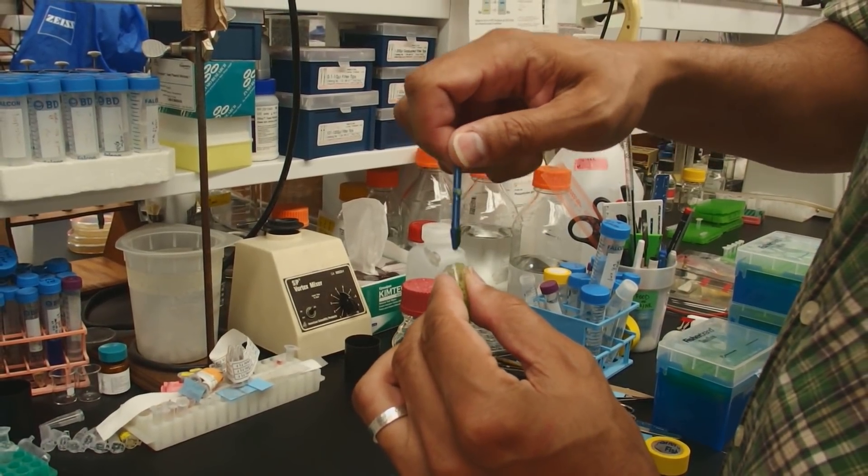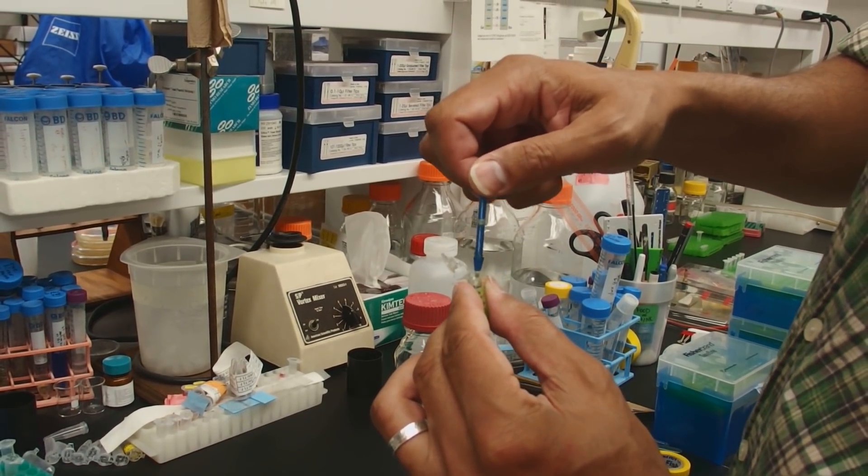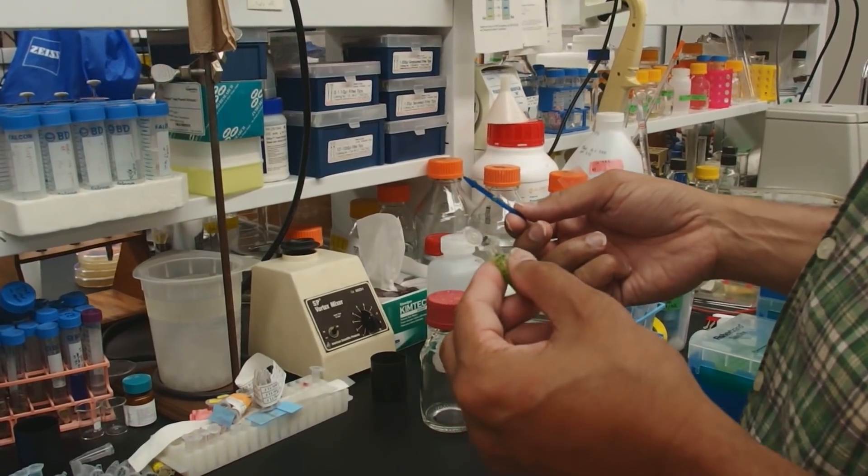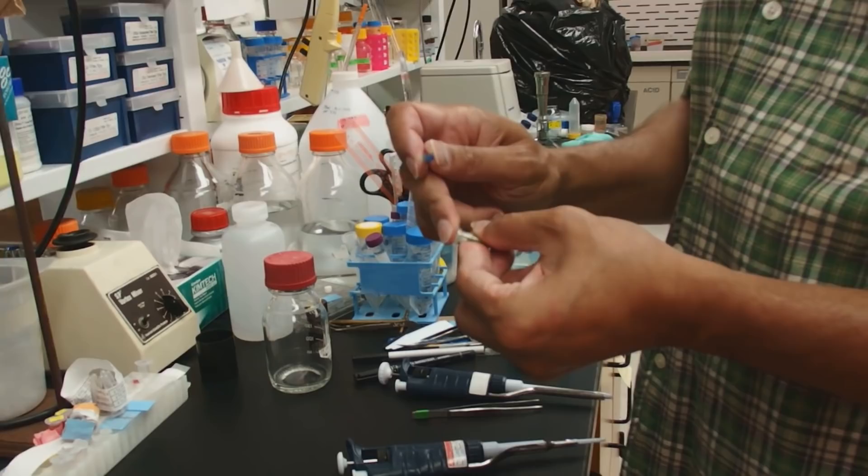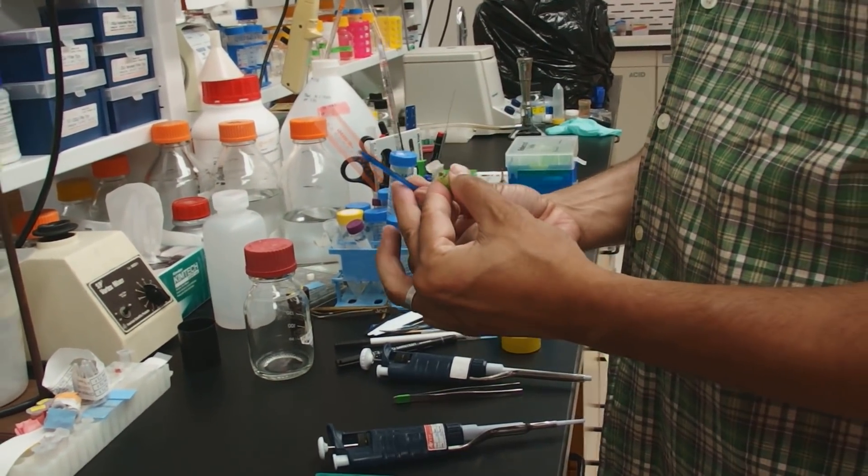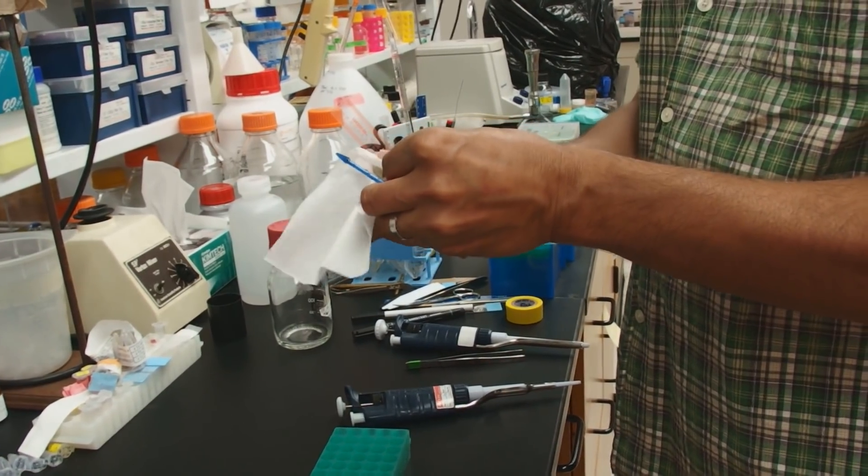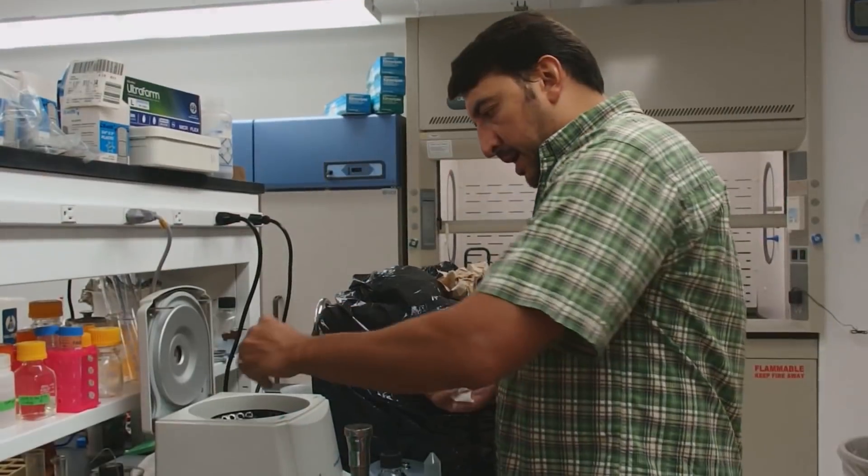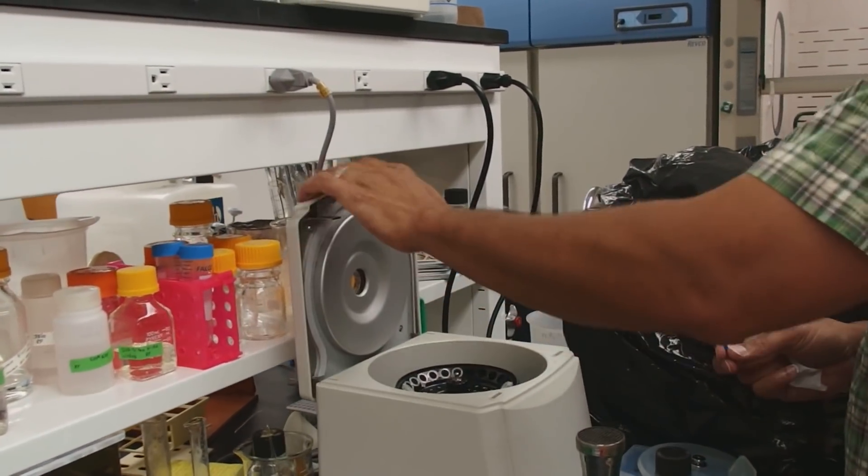Yeah, that's good enough. I used a lot of leaf, so I'll have a lot of genomic DNA for a number of different clonings. I'm going to just close that up, and I'm going to take a kim wipe. I'm going to wipe it off because I've got some bubbles on the outside. I'm going to just give this a real brief spin down so that it's on the bottom of that tube.